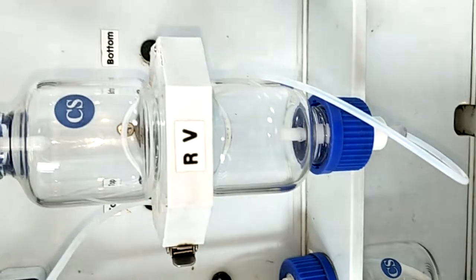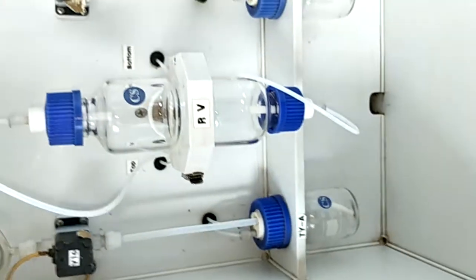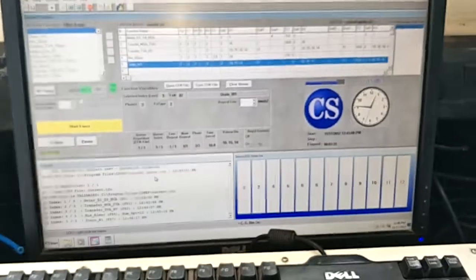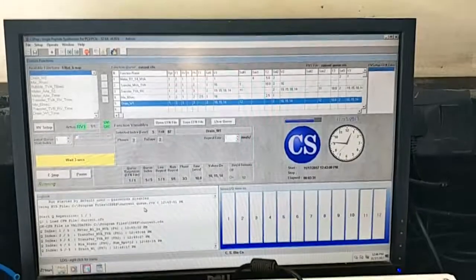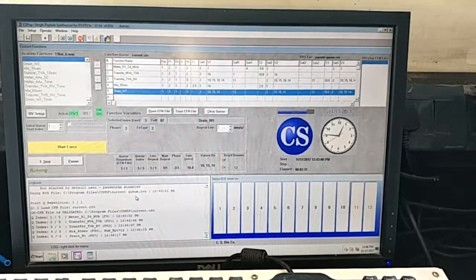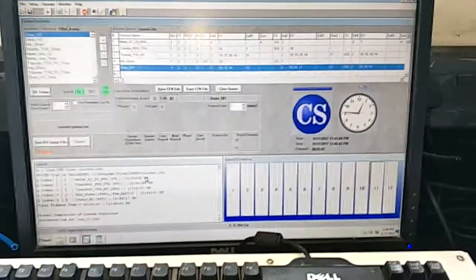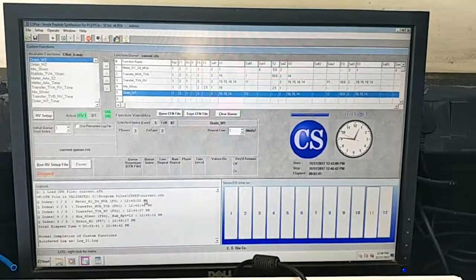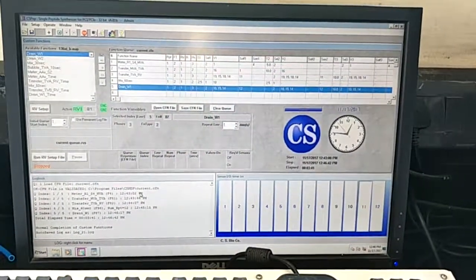Drain has taken place, but no mixing was done. Kindly advise for the same.